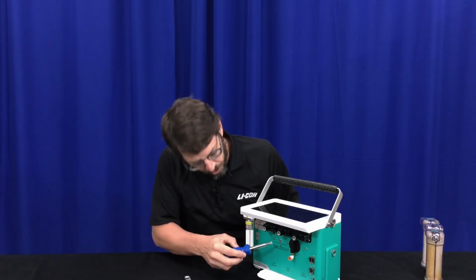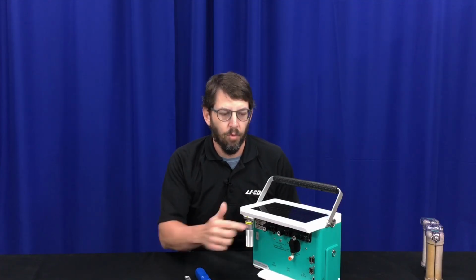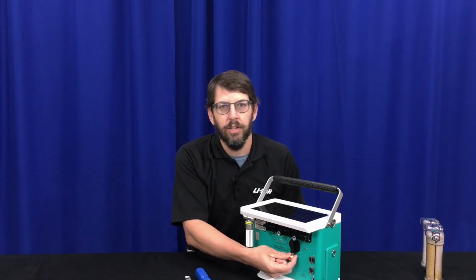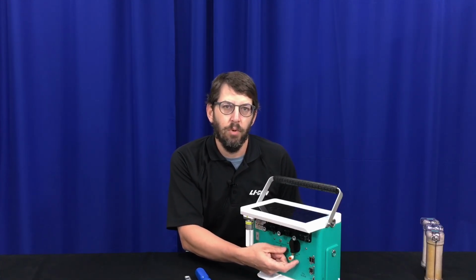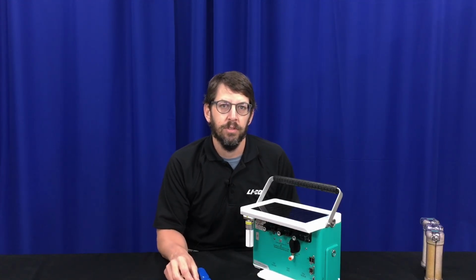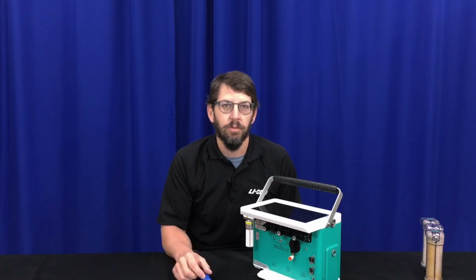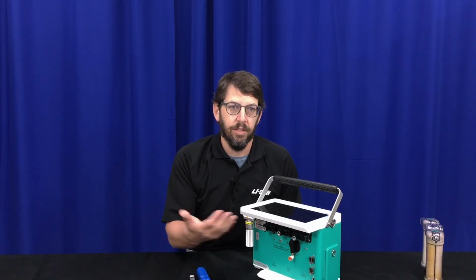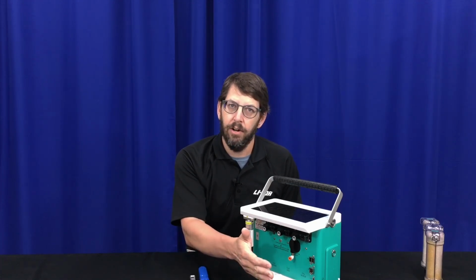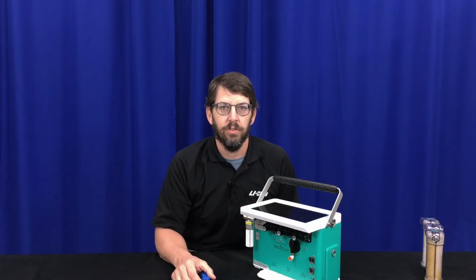The differences between these two locations are where they are in the airstream once inside the console. So this first one here at the air inlet is upstream of both the pump and the CO2 scrubbing chemicals. So you would have the ability to scrub CO2 using this one if you needed to, but you also would need to leave the pump on, and in that situation oversupply your tank air and let the pump pull what it needs to not cause any pressure issues through the system.